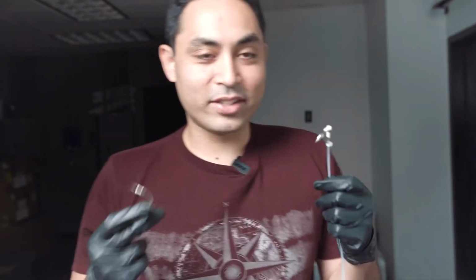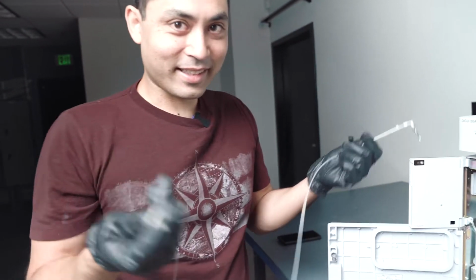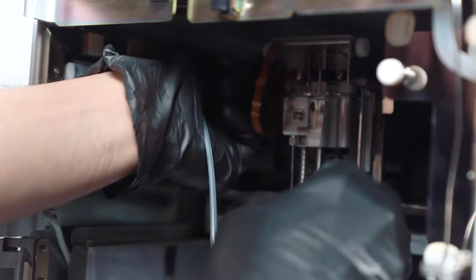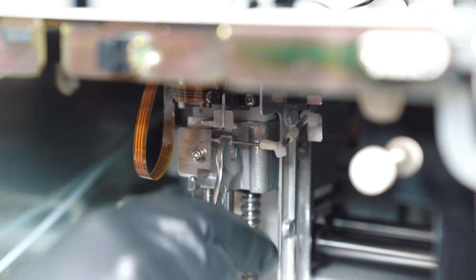All right, so now we have our new loop and we're gonna replace it. It's the same loop, but these are expensive. It's not bad, it still works. Let's start by putting this back through the rectangle in the back and pulling it through. I'm fishing the line back through this little rectangle. That's pretty important for the positioning. And then you wanna go ahead and tighten the screw here. A 6mm wrench is pretty much all you need. Let's get that guy in and let's snug it up. Okay, it's nice and snug.